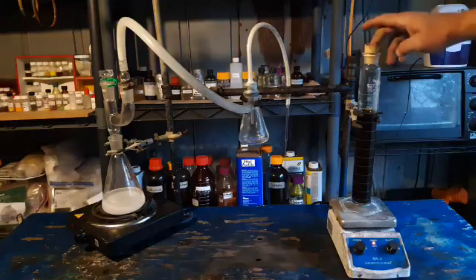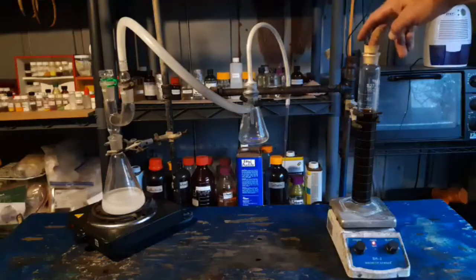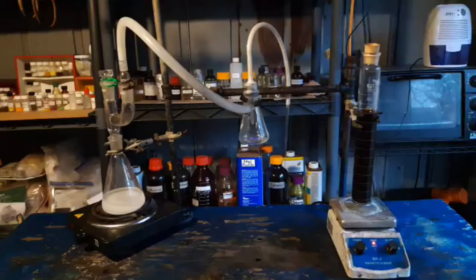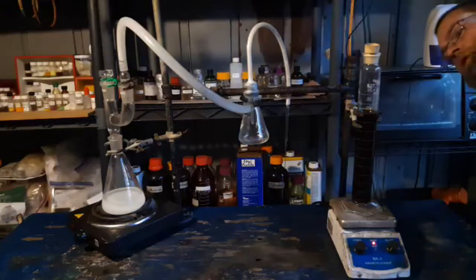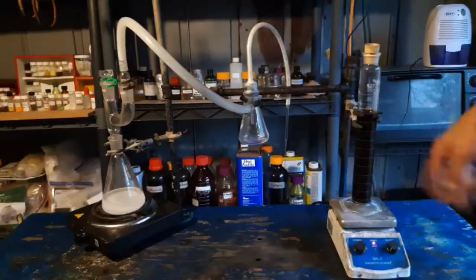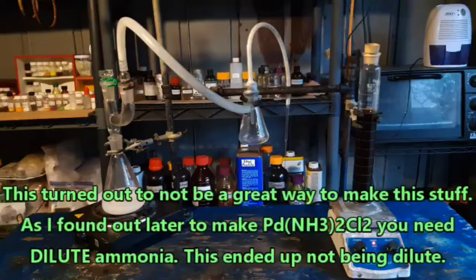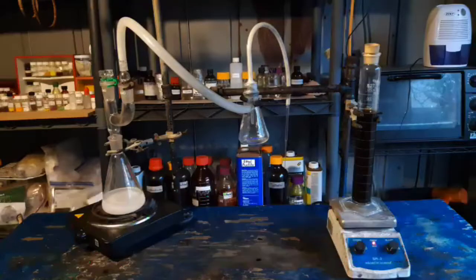What I have here is 1.8 grams of palladium dichloride dihydrate in 210 mils of water. I've got it in a graduated cylinder like this because I'm going to bubble ammonia gas through this. I am out of aqueous ammonia. If I had aqueous ammonia, I could have just combined the palladium dichloride dihydrate with water and it drops out a light brown precipitate.